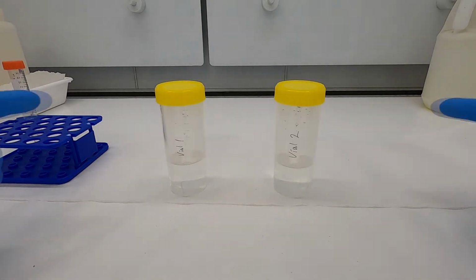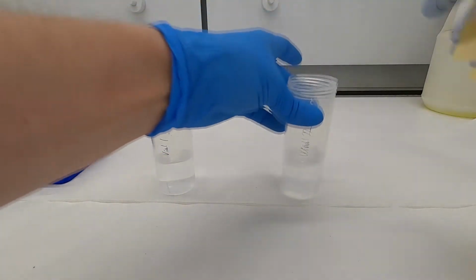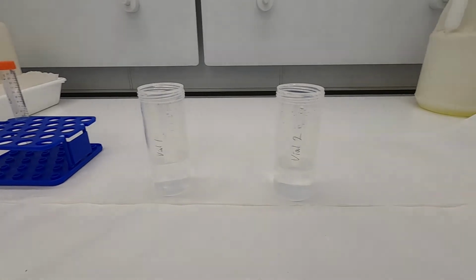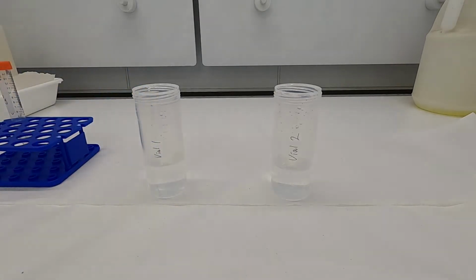Okay, so we're going to start with these two vials. These vials contain tap water, and the water in these vials, well, they're capped now, but they have already equilibrated with carbon dioxide in the atmosphere. So we know how much CO2 is contained in the atmosphere at present. So from that you can calculate, from theory, what the pH of the water is.